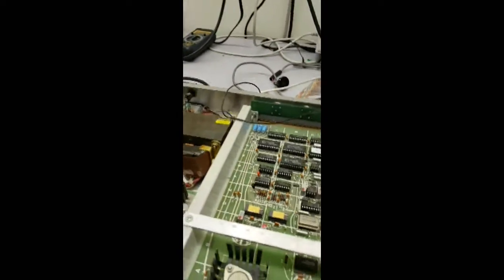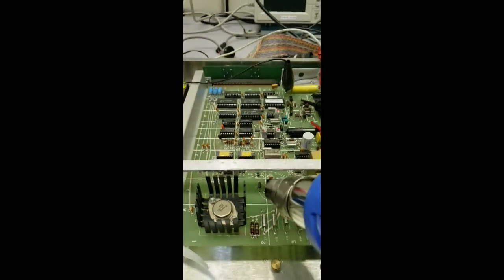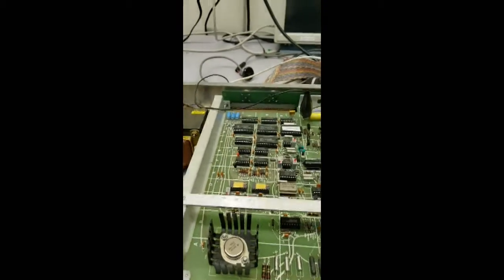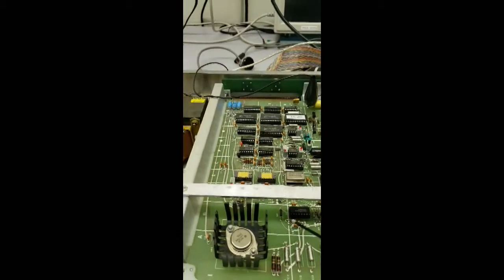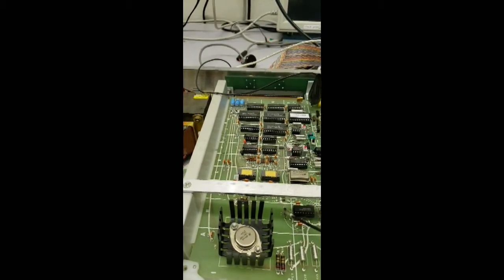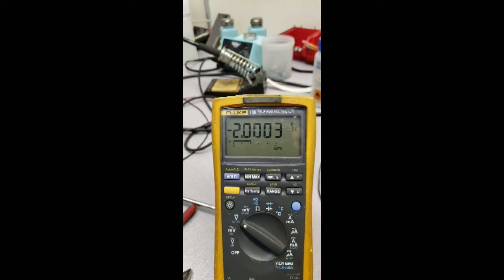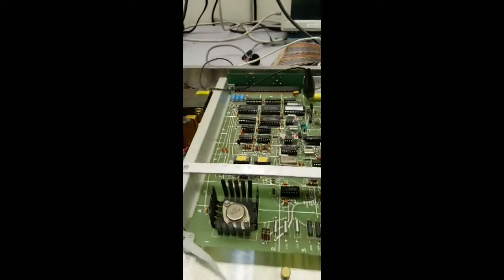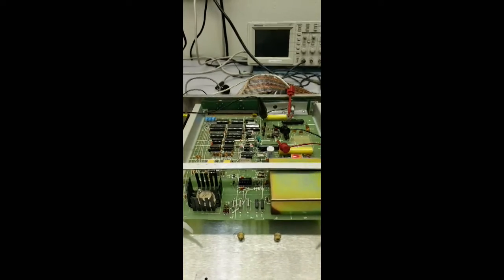I always like to confirm, so let's do it again. Let's heat it up one more time. Click, click, click. Cool down. Stable fine supply. Stable high voltage, about 2000. It's going to be a little unstable because I've got this board heated up quite a bit. Okay, and that's how you do it. So you can use a combination of heat from a heat gun and cool spray to thermally isolate a faulty component.